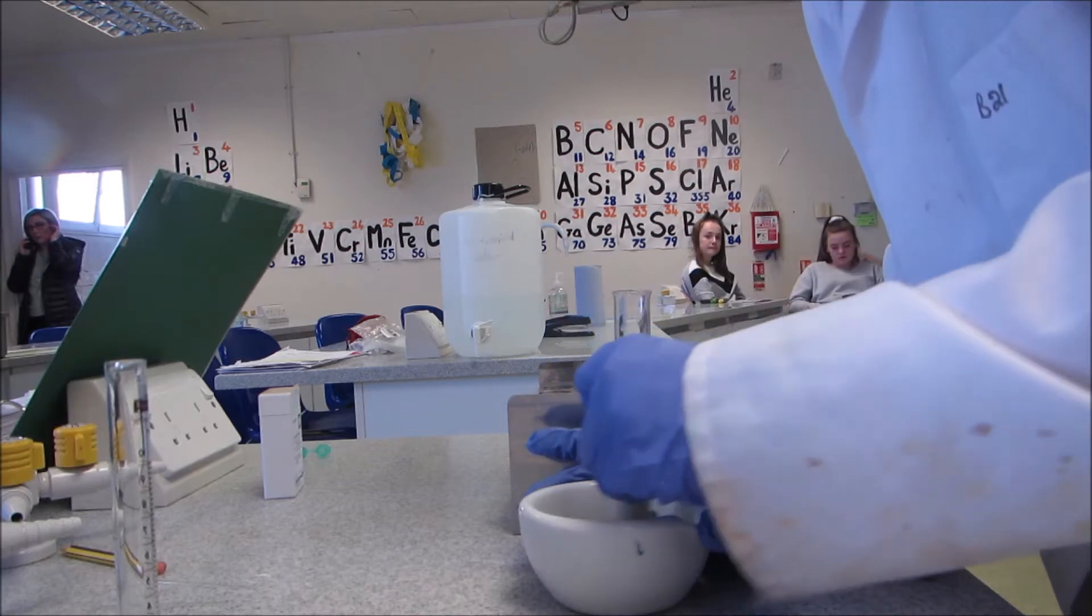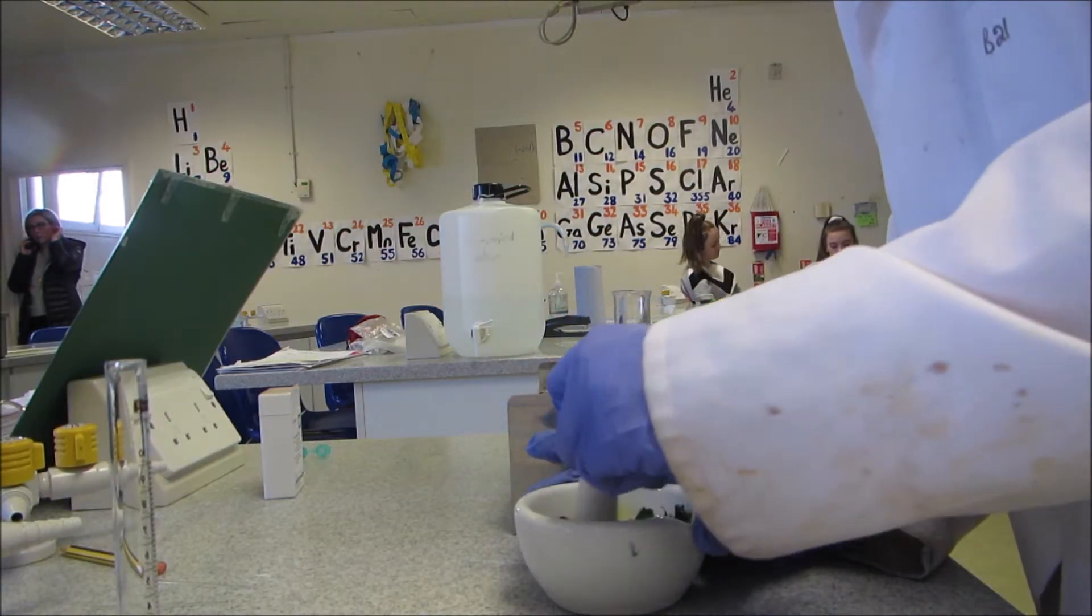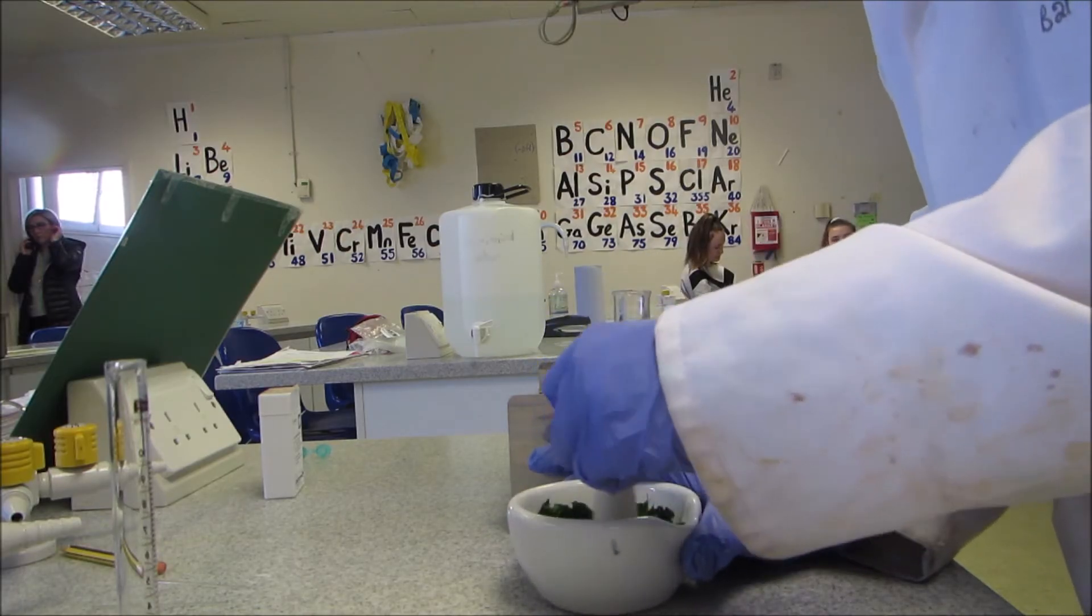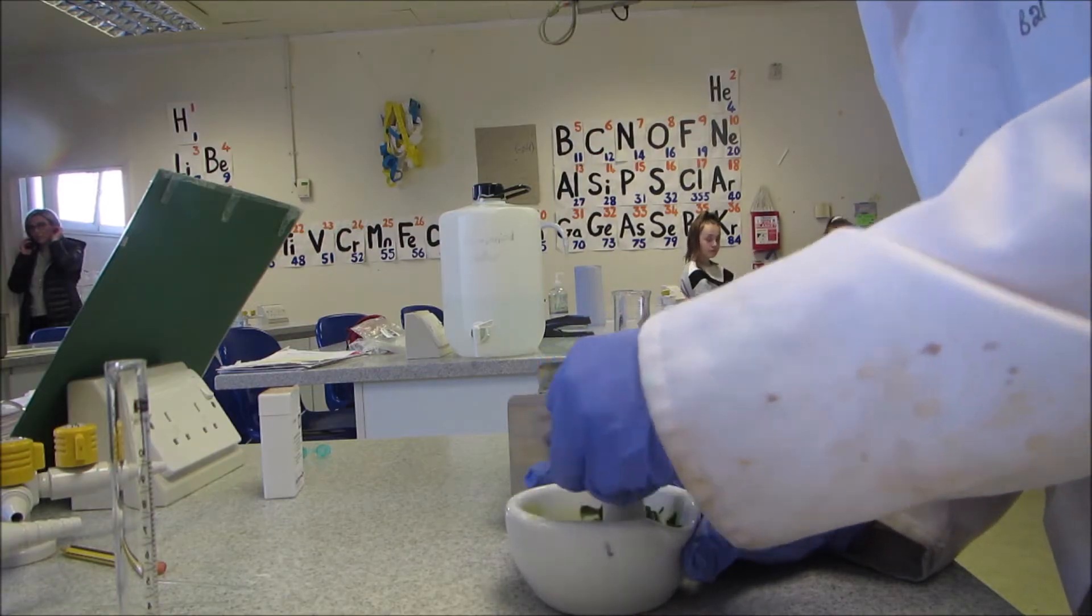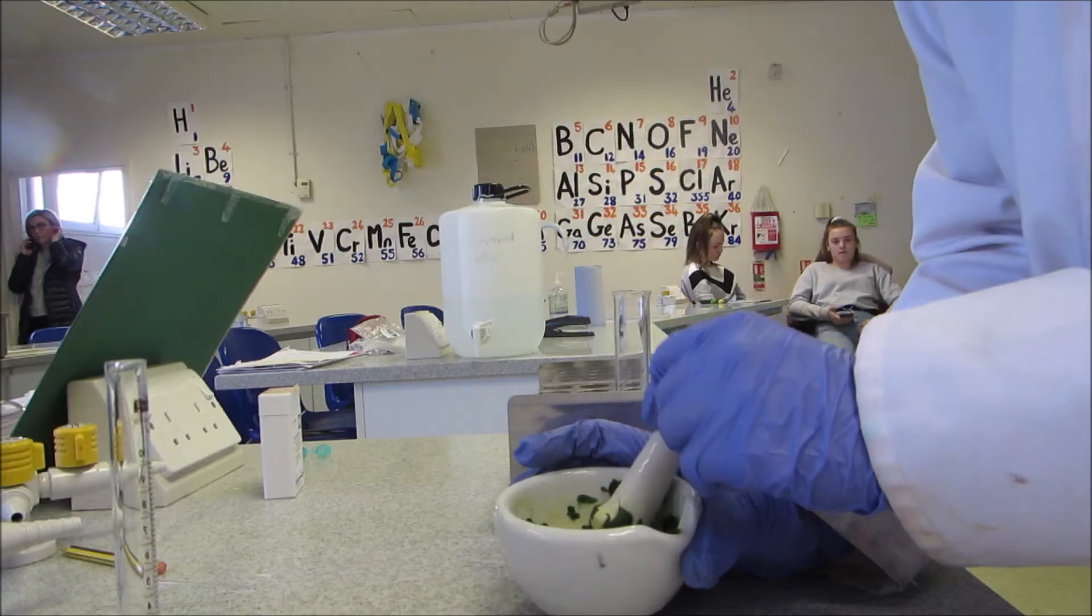I'll give it a nice mix, try and grind as much as you can, and then you're left with sort of a liquid.